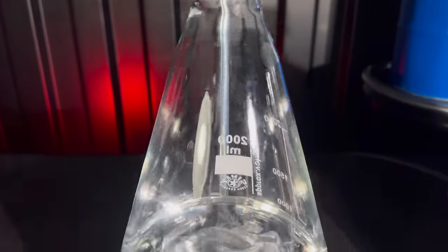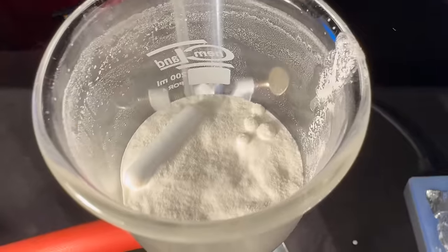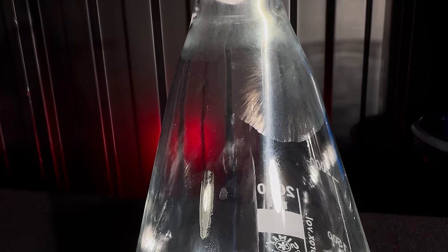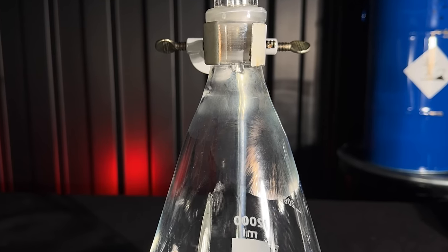Now that the waste was filtered off, there's a beautiful clear solution of product. I waited a little too long and as acetone evaporated, I observed this fascinating crystal formation.